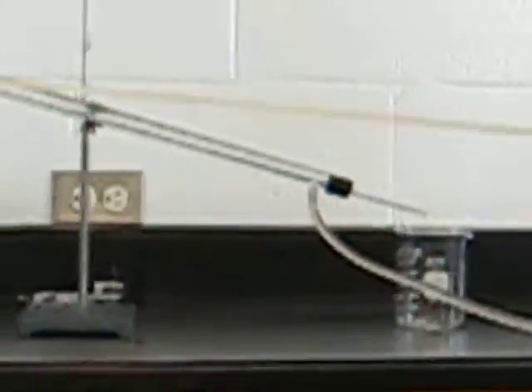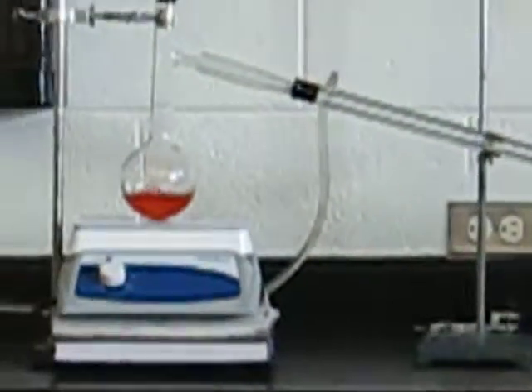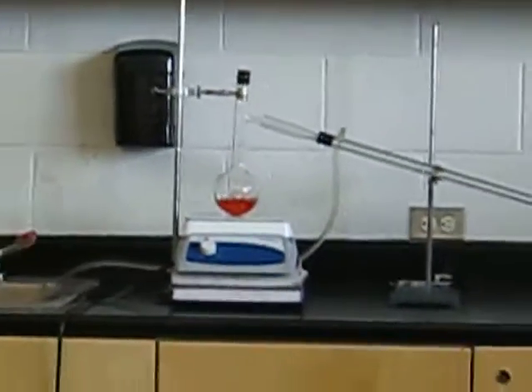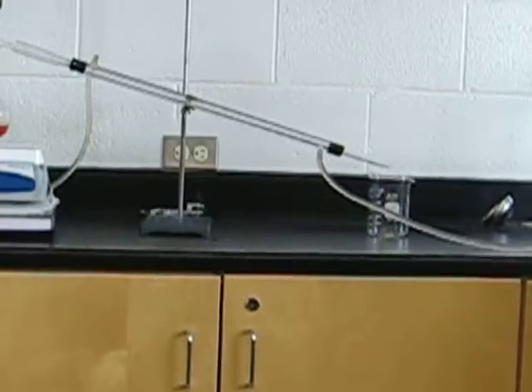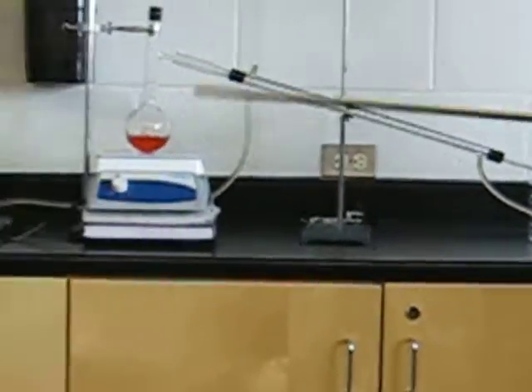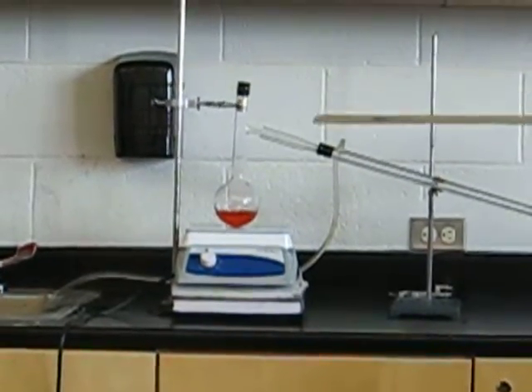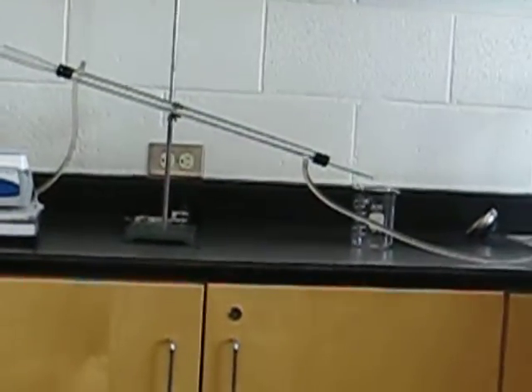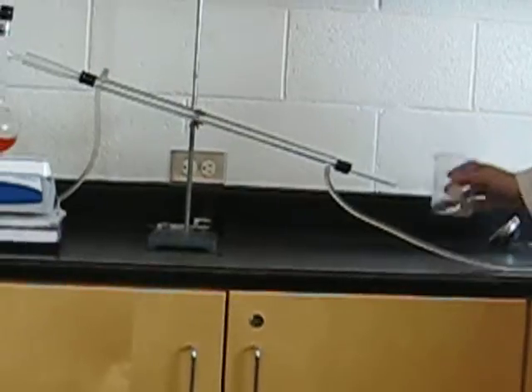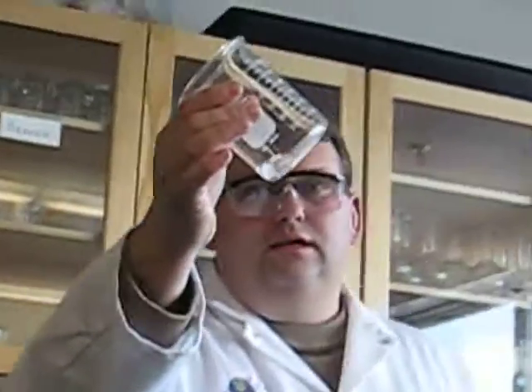So, we go from an orange liquid solution to a clear, colorless solution. Our Gatorade starts off, goes through evaporation, then the water vapor goes through condensation and returns back to a clear, colorless liquid.